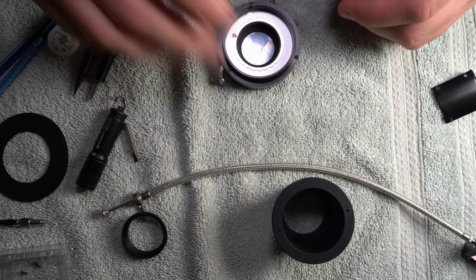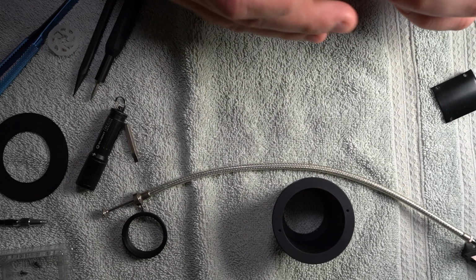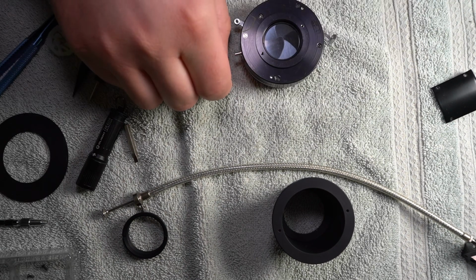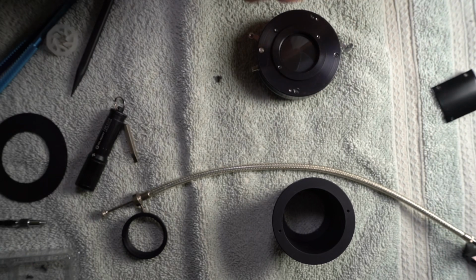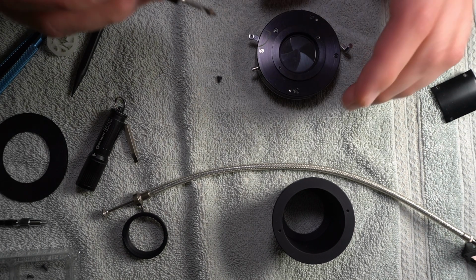So now I've got to remember how the rest of this thing went together. Now I know this is the top, so that is the bottom, and these two screws go to the bottom. I should have filmed taking this apart, but that's actually why I'm filming putting it back together, because you can just reverse the video and you'll know. It'll sound really weird, but you know.